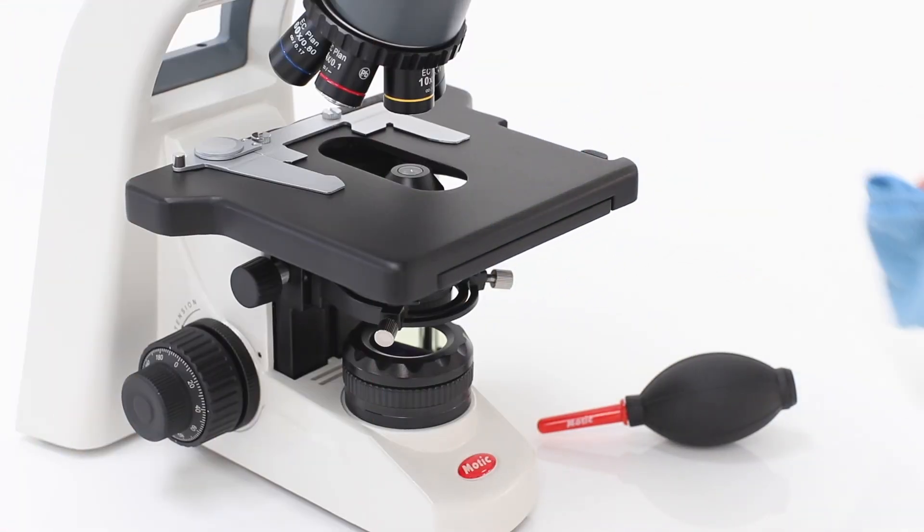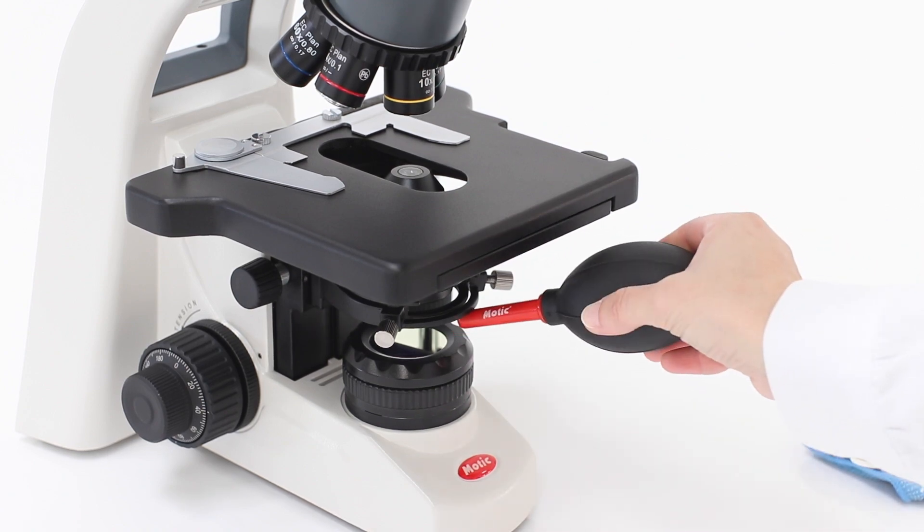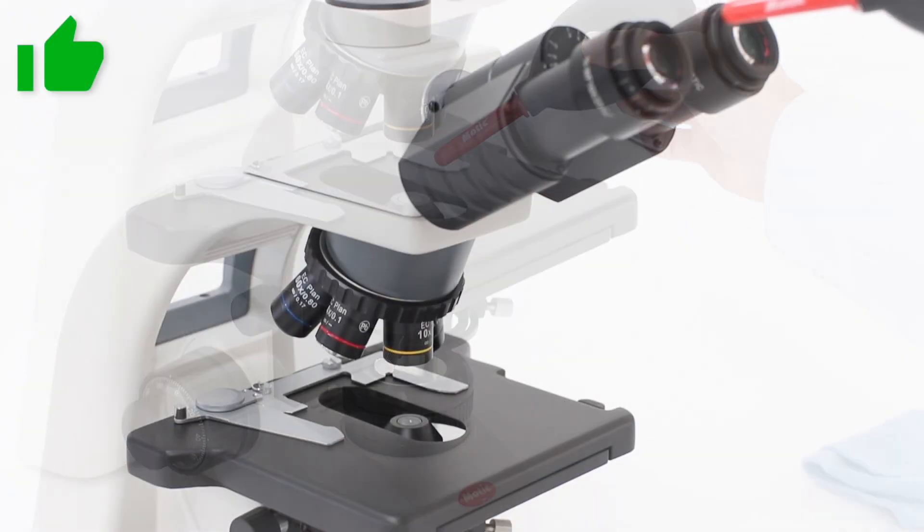Dust and dirt are two of the main causes of malfunction in a microscope, so always clean it before and after use.